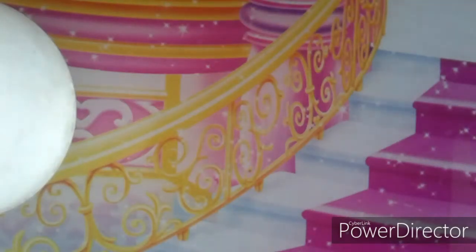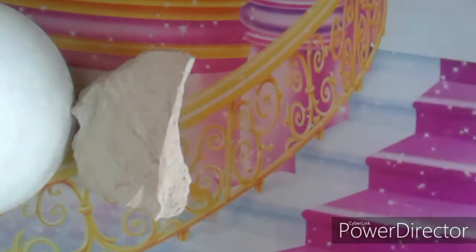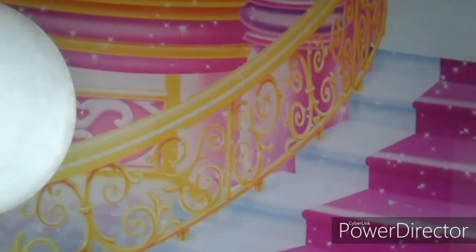In this video, I'm going to show you how to make calcium sulphate from an old piece of POP. You will need an old piece of POP, a cutter, a labeled bottle, a container, calcium sulphate, and a spoon. You also need a grinder to grind the old piece of POP into powder form.